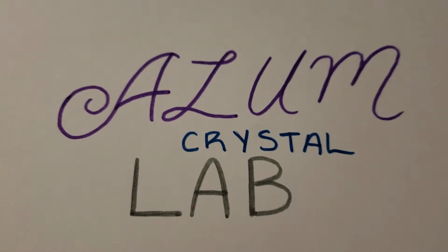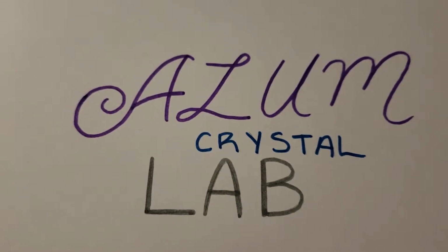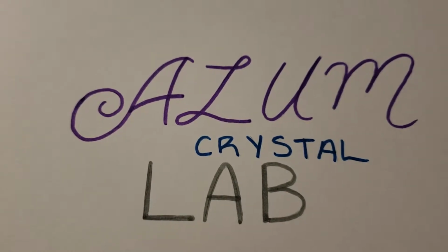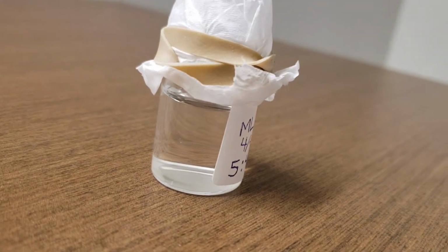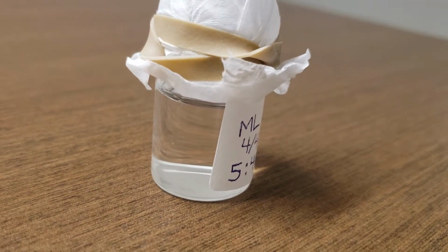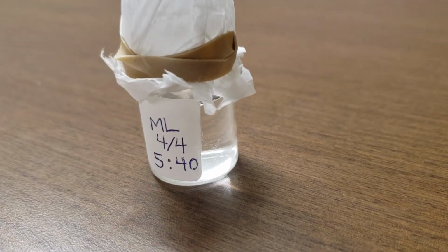Once again, my name is Monica Lund, and I'll be talking about the ALUM Crystal Lab. This is the second of 3 videos tracking the progress of my vial's ALUM crystal growth, and it has been a little over 2 weeks since I have performed the experiment. Similar to the first video, there does not appear to be any crystal growth, as the vial solely contains the aqueous solution of alum. Thus, progress of the crystal growth will have to be captured in the final alum video.